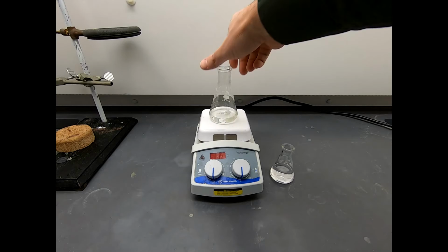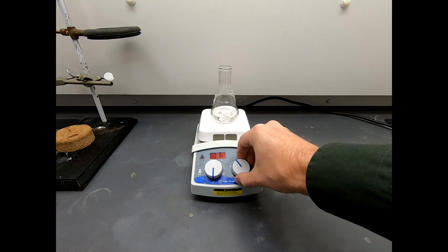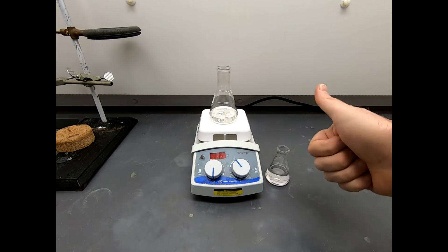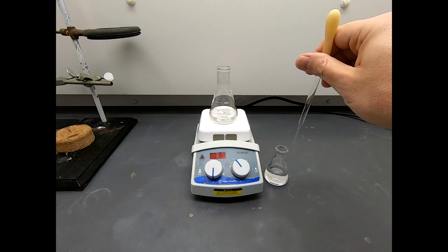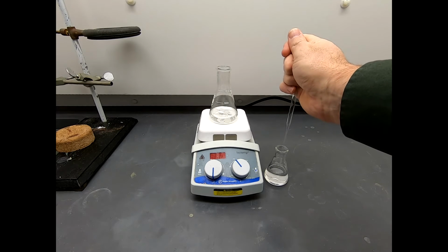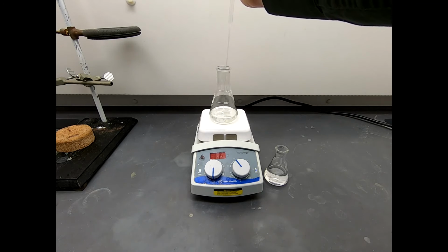Okay, now we're in the hood, and we have our KOH solution, and I have added a stir bar to this, and I'm going to start that going. Great. And we have our solution of benzaldehyde, acetone in a mixture of ethanol and water. What I'm going to do is transfer this solution, our benzaldehyde and acetone solution, into our KOH solution. I'm not going to do it all at once. I'm actually going to add it by pipette. And this is going to take a little bit of time, but it will allow us to sort of watch the reaction occur. So you can see that was a full squirt of a pipette.